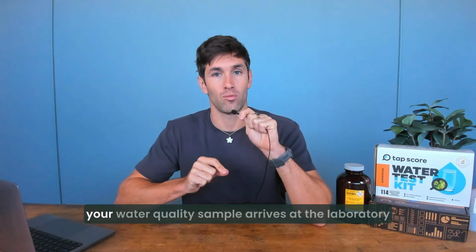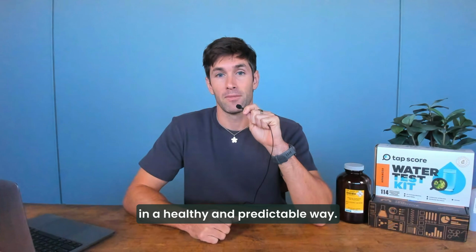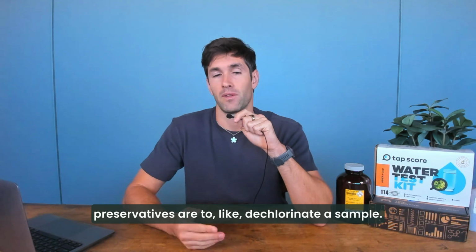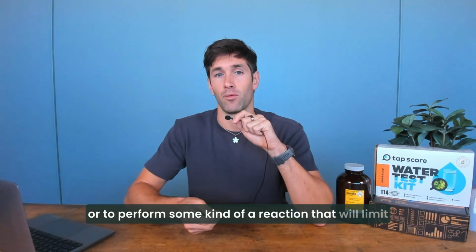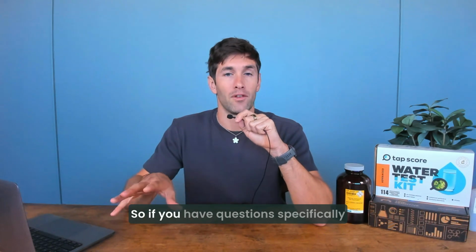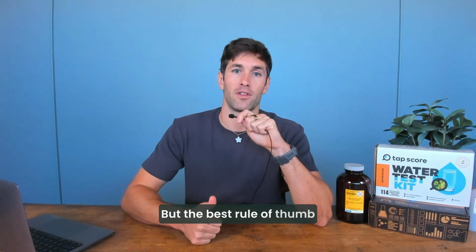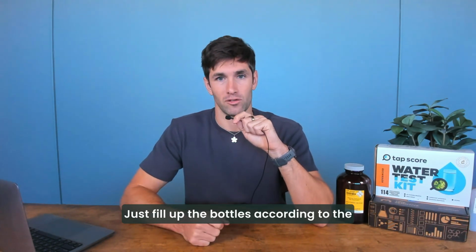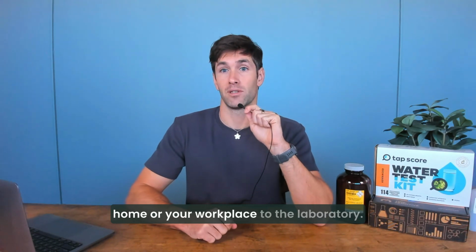It is in there to make sure that your water quality sample arrives at the laboratory in a healthy and predictable way. Some of the most common uses for these preservatives are to dechlorinate a sample. It's also very common to control the pH of a sample or to perform some kind of a reaction that will limit your sample's ability to change while it's in transit. So if you have questions specifically about preservatives, definitely reach out. But the best rule of thumb is just don't touch the preservatives. Certainly don't eat the preservatives. Just fill up the bottles according to the instructions and let the preservatives work their magic as your sample makes its trip from your home or your workplace to the laboratory.